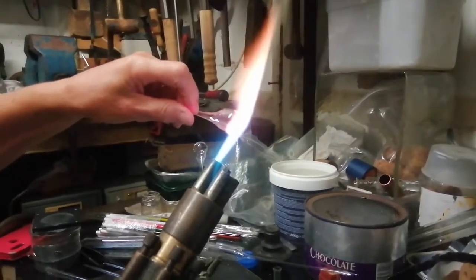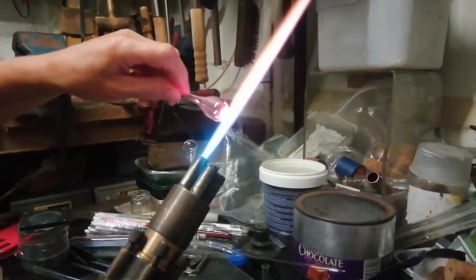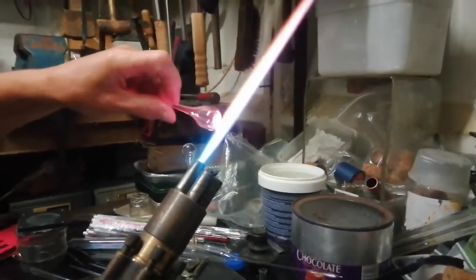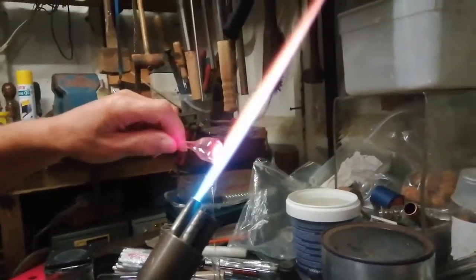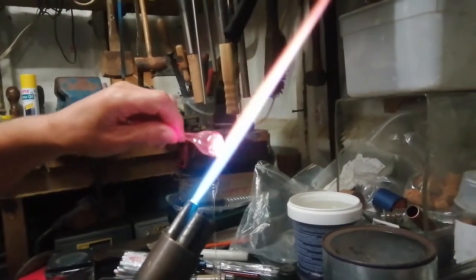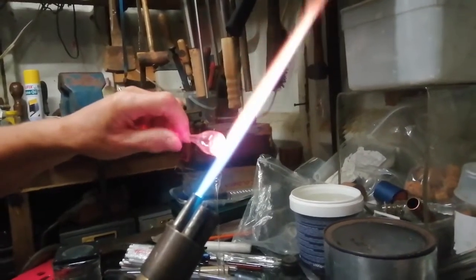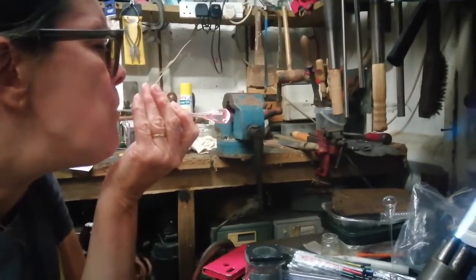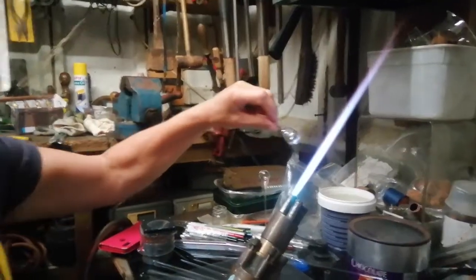The key thing for all beginners is learning to turn the glass evenly and keeping it in the right part of the flame. And it is difficult, isn't it, Carolyn? It is difficult. Yeah. But you're doing very well. That's excellent. Just a bit further in the flame. Keep turning. Get back up onto the shoulder a touch more. That's very good. And I think it's time for a little blow. Take it out and blow gently, harder. That's excellent. Okay, in we go again.